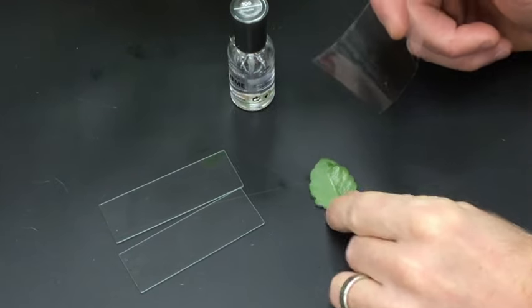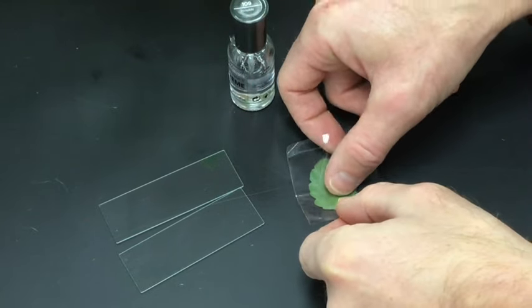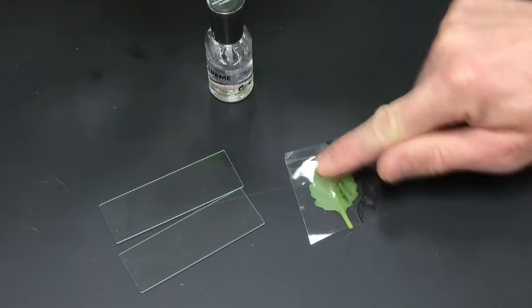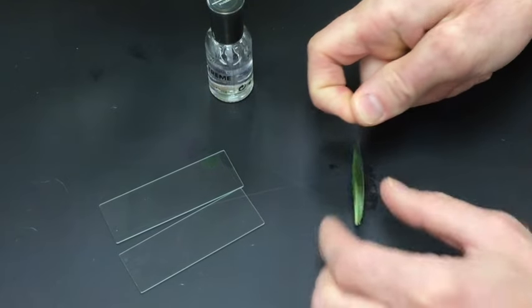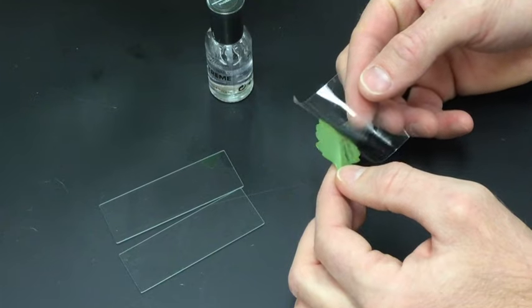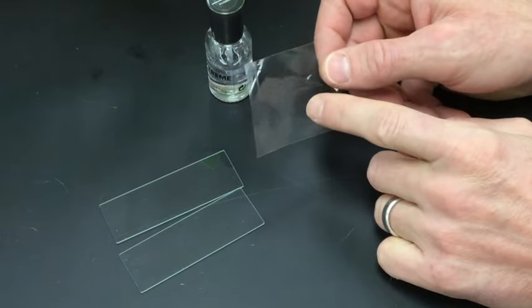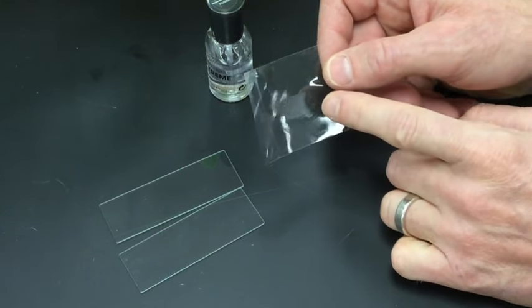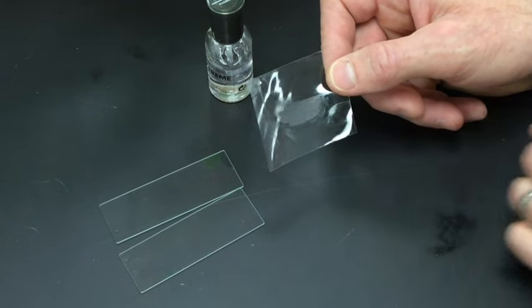So I'll do the succulent first. Okay, press down the tape onto the part that you made an impression of, and you can remove the tape. And that's the impression. I didn't remove the cells really. What I did is remove what's called the waxy cuticle, or an impression of the cells.